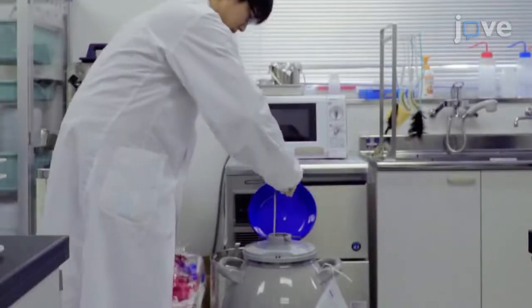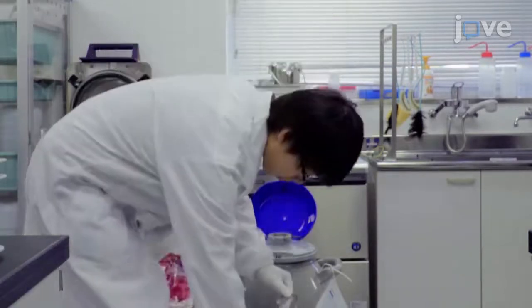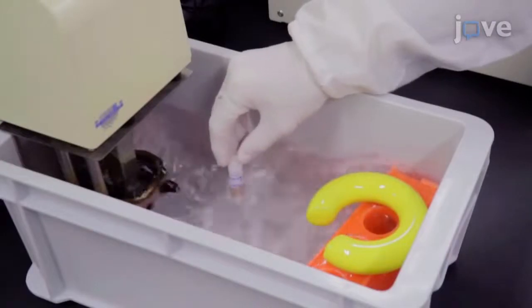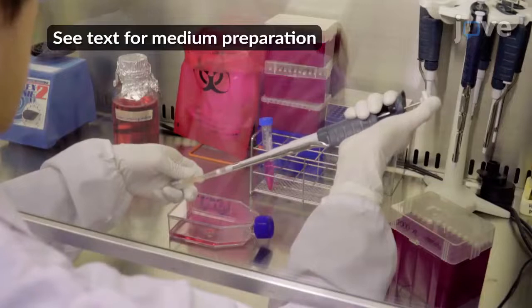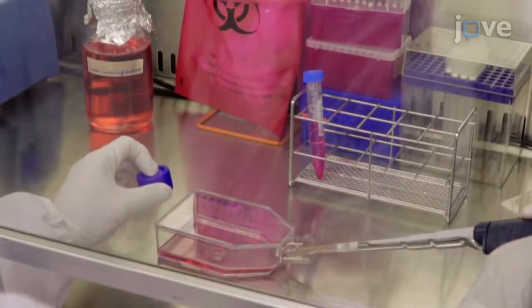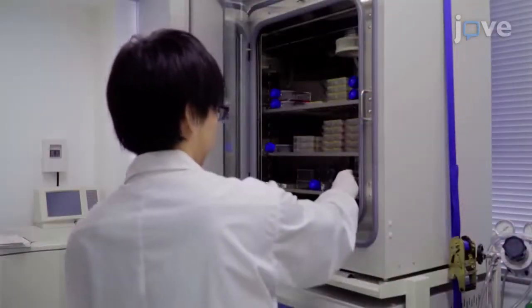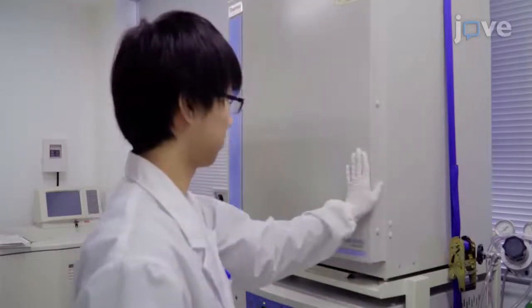Remove a cryotube containing Ma104 cell lines from the liquid nitrogen container. Place the cryotube in a water bath at 37 degrees Celsius to thaw the cells. Add 1 milliliter of the cell suspension to 20 milliliters of the serum-containing medium in a T75 flask. Incubate the flask in an incubator at 37 degrees Celsius and 5% CO2 for 2 to 3 days.